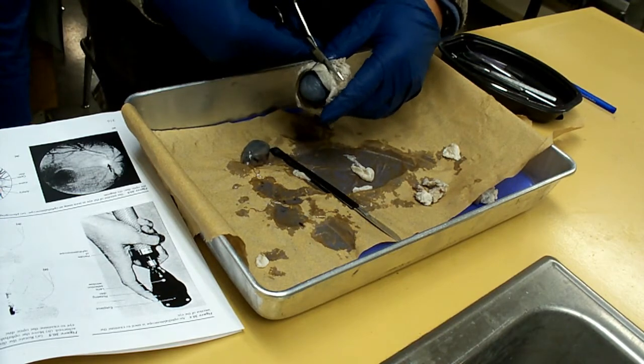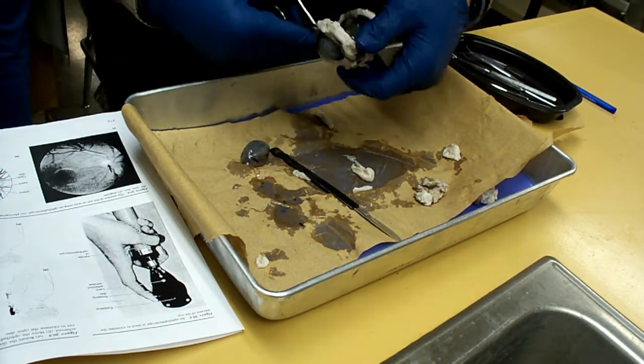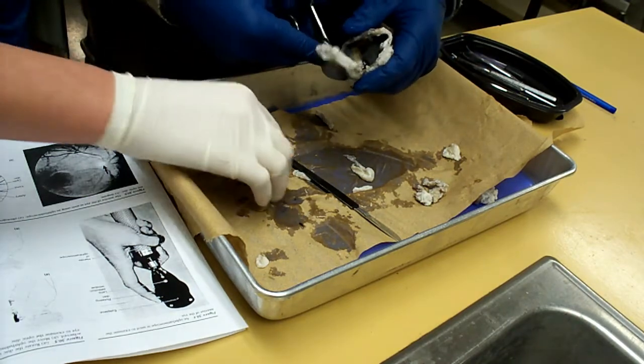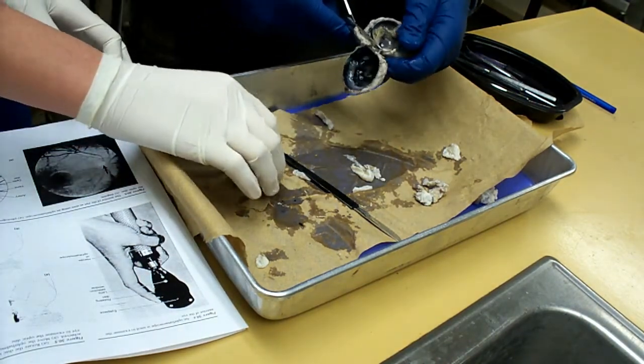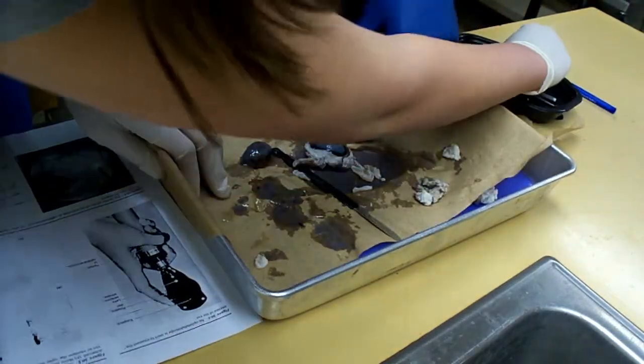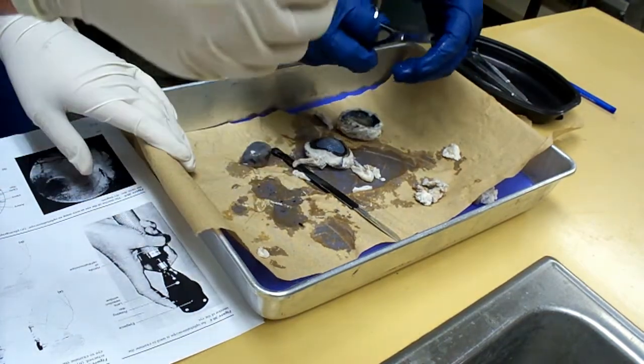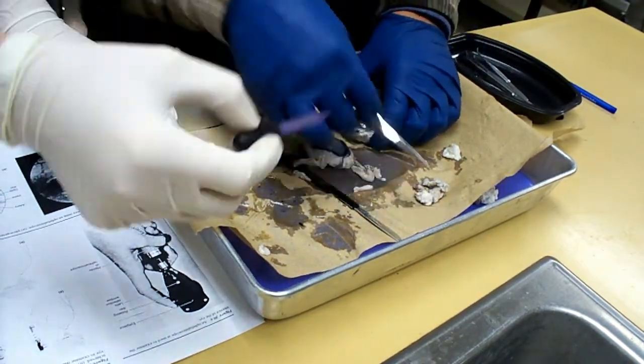Ewww, what the heck just fell out? Remember, that's supposed to be the lens. Oh yeah. The lens fell out? Why the heck would the lens? Just touch it. No, it's the lens and all the vitreous humor. Where's that suctioning cubby thingy? There's the suctioning cubby thingy. That ain't gonna do me good. I'm gonna squeeze you with it. Now, where's the optic nerve?